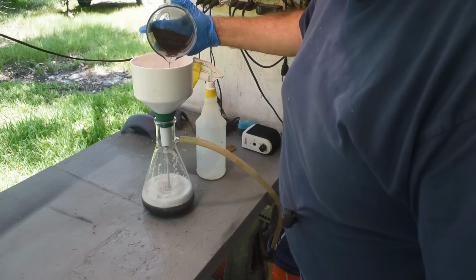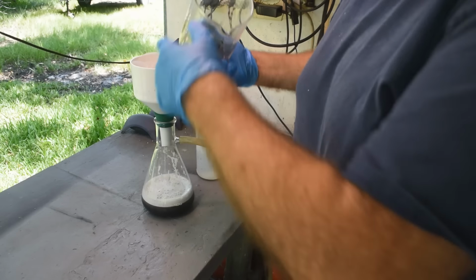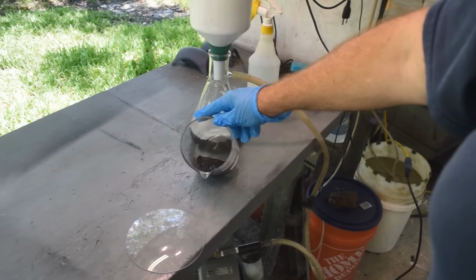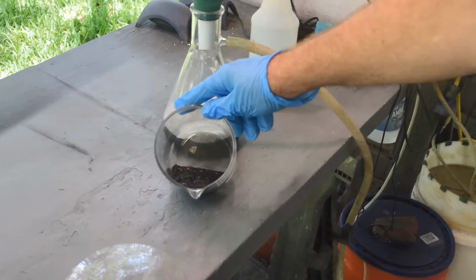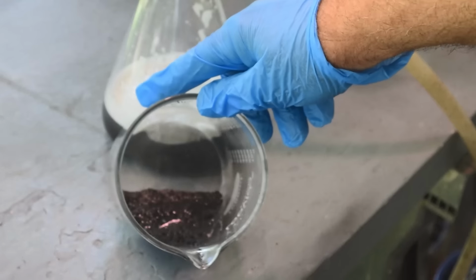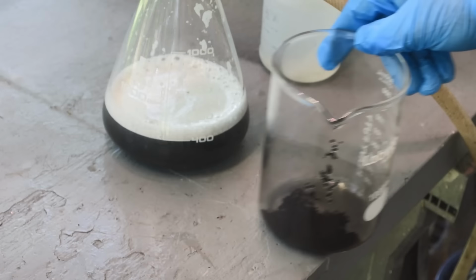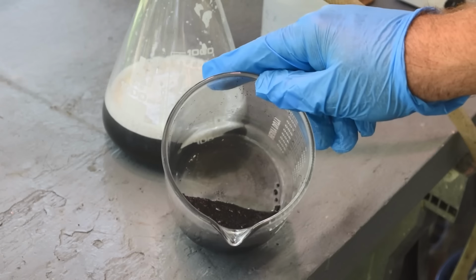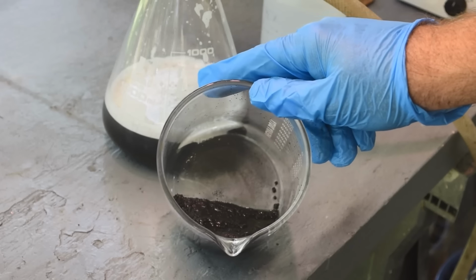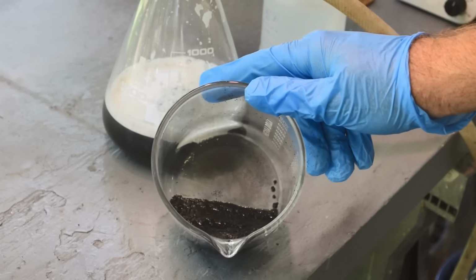Okay, there we go. There's some solid palladium in there. It actually looks like a fair amount. Let me give you kind of a close-up look at that. Okay. So it's not all this super fine crap that's going right through my filter. Ugh, that's annoying. We still do have a lot of powder here that's reasonably cohesive.